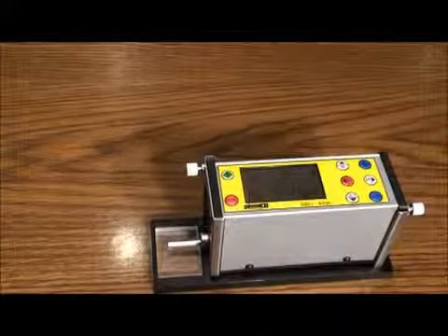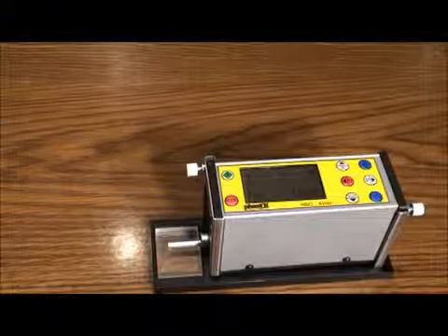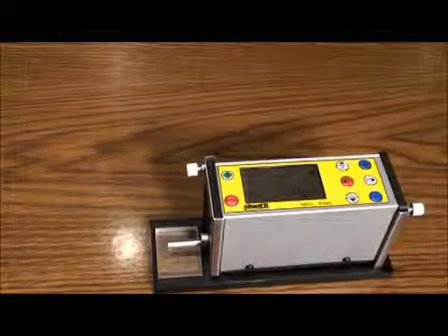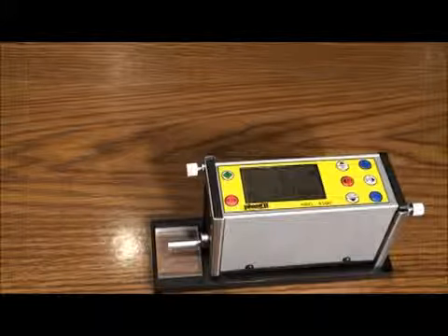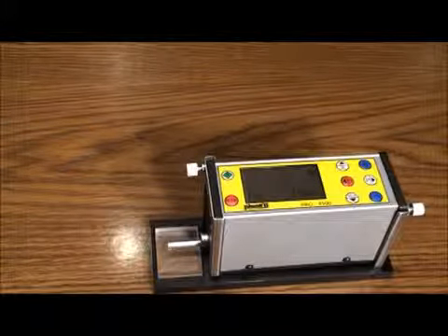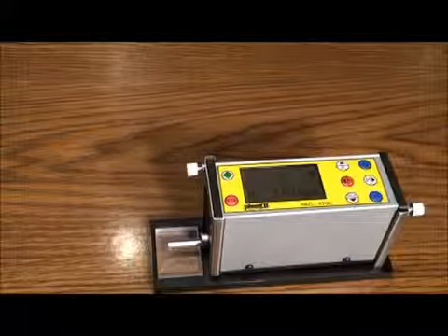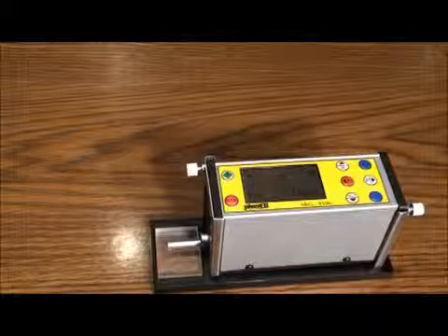This is an instructional video detailing the applications and functions of the Phase 2 SRG 4500 surface roughness tester. The SRG 4500 is an instrument designed to check surface finish with measured values displayed on a digital readout in various surface roughness parameters. Note the SRG 4500 is an extremely sensitive instrument and should be treated with care to ensure measurement accuracy and reliable performance.